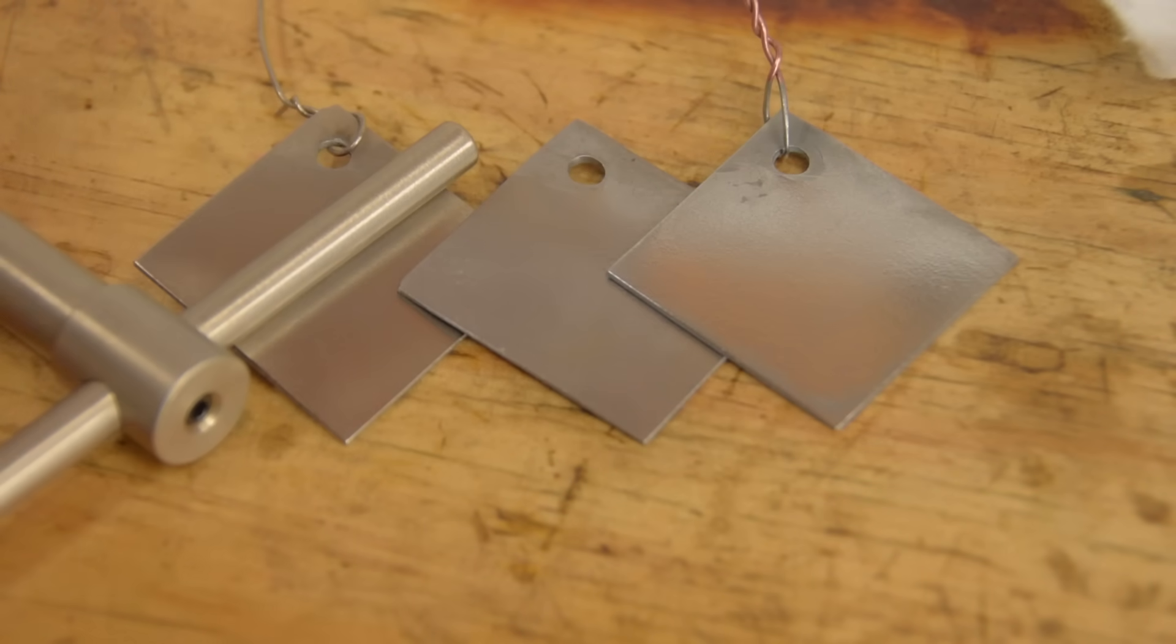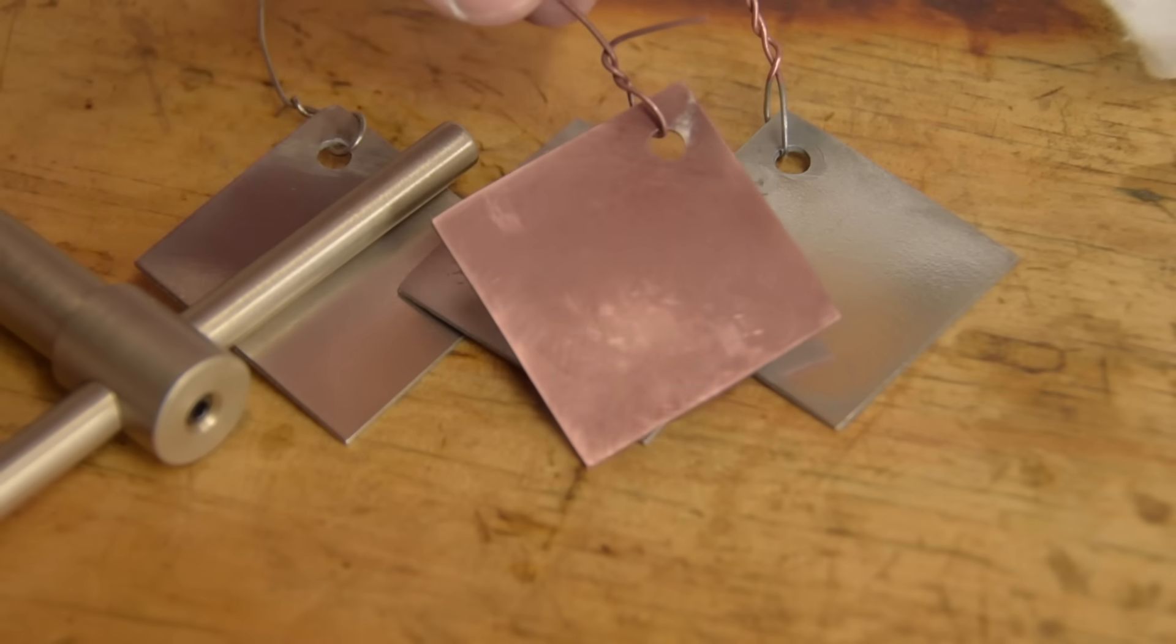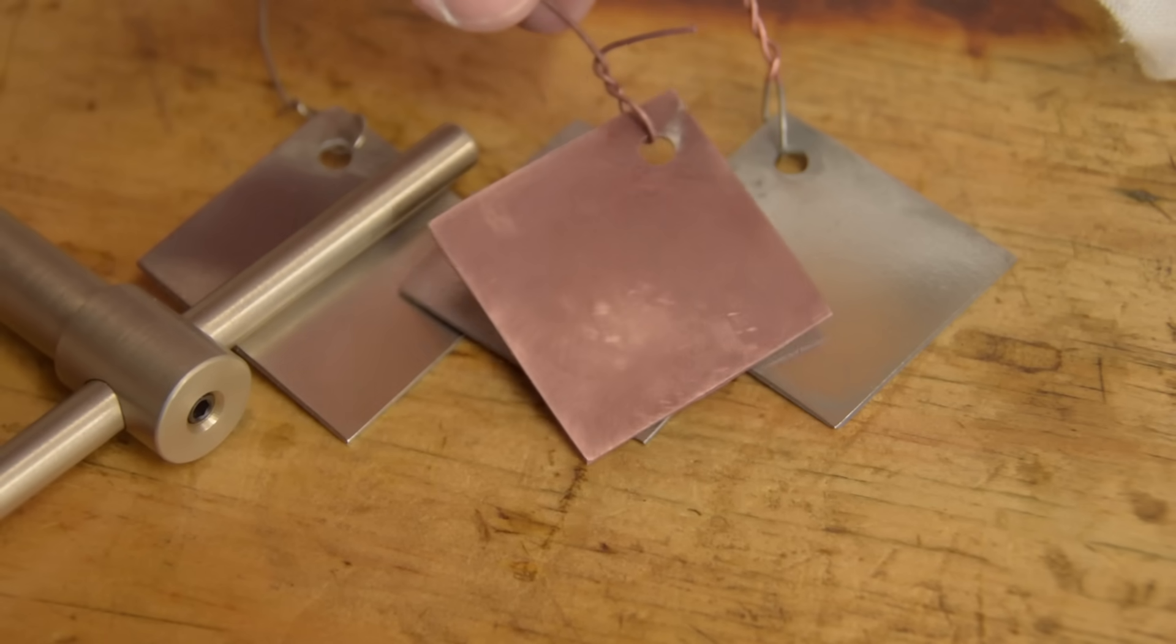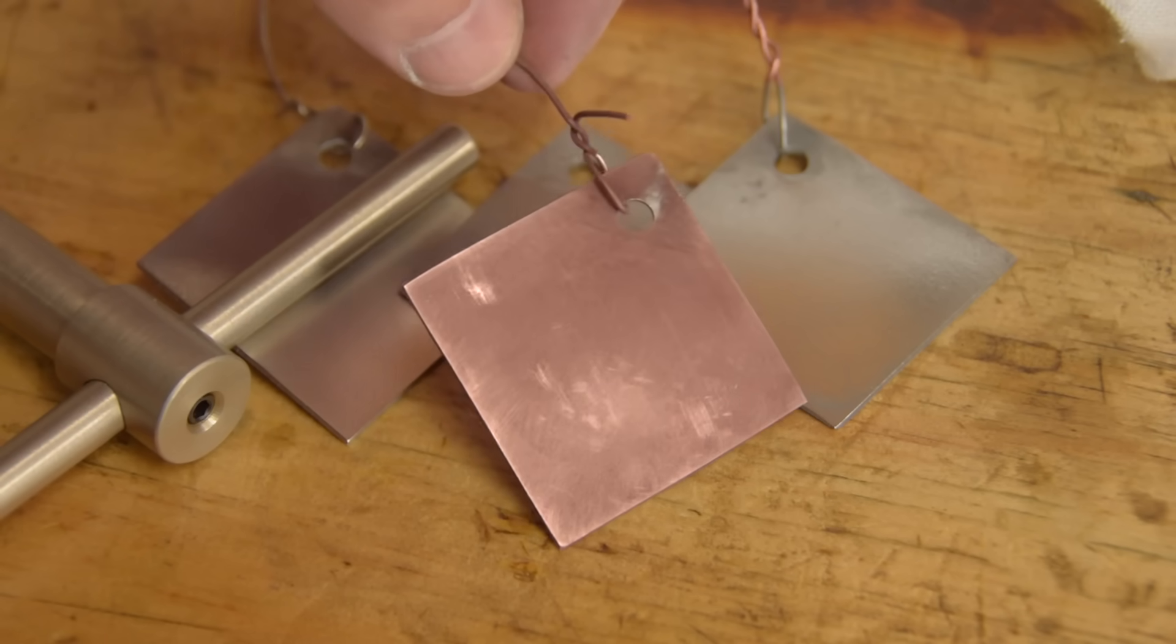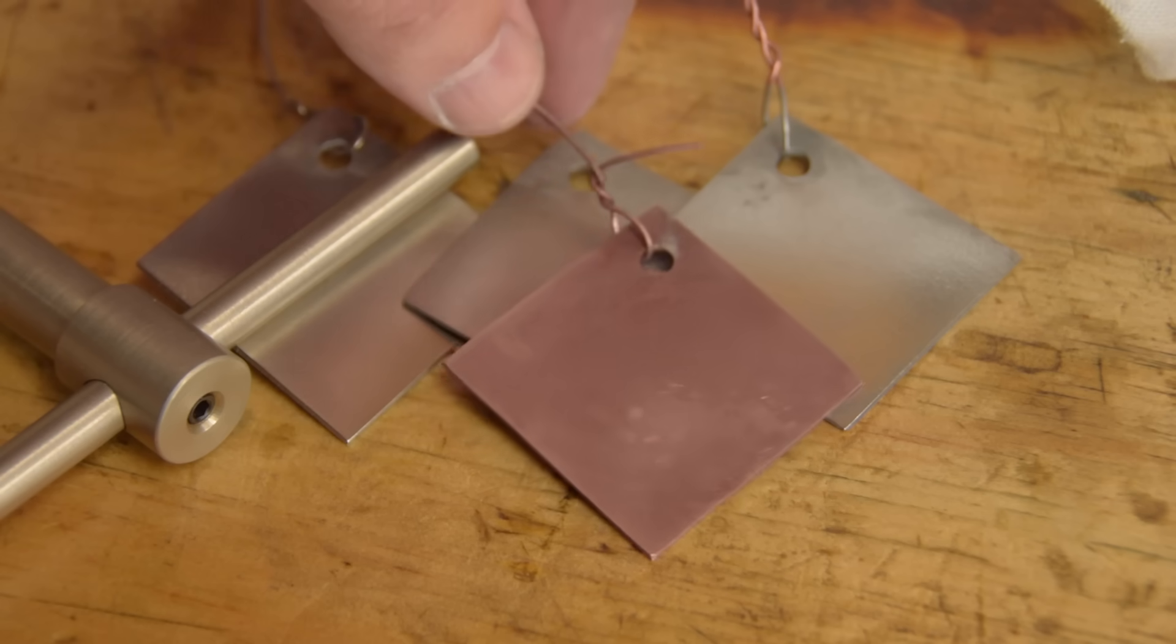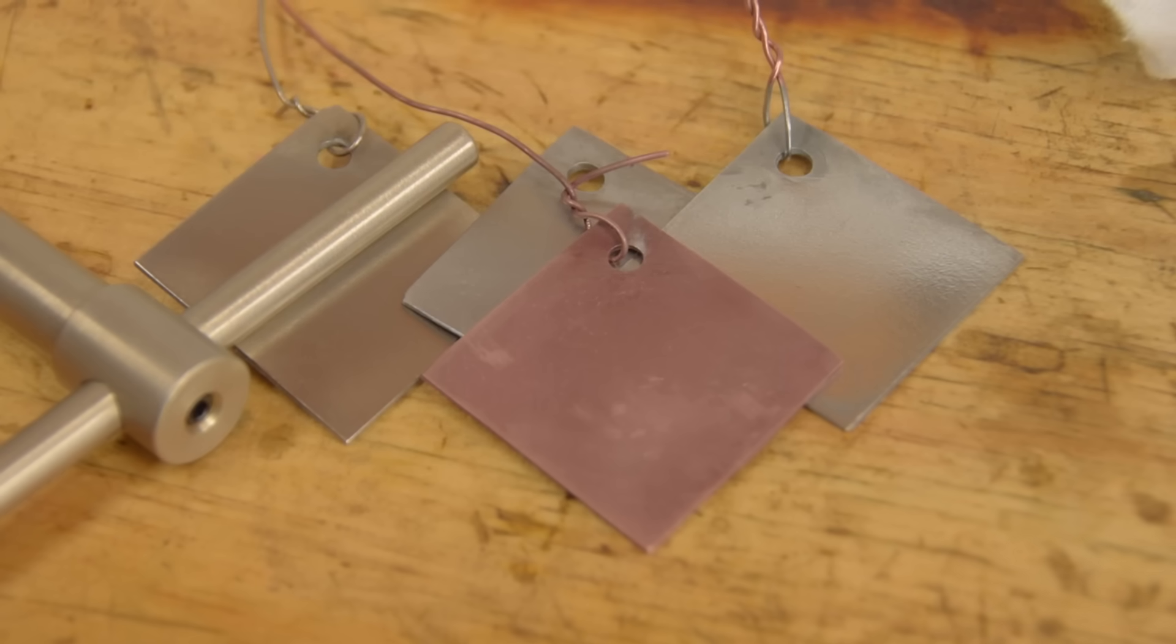And finally, copper. This is a little smutty. The copper I was using is just copper sheet from the hobby store, not necessarily pure. But it turned out okay.